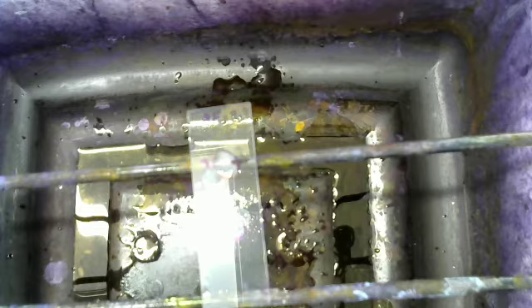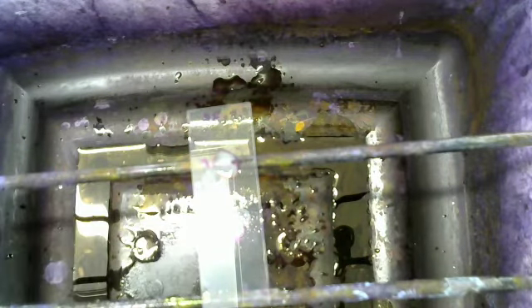Now we are going to do one last time. This time we're going to do it on the same slide. Here's our acid-fast positive and our acid-fast negative. Same as before, start with some carbolfuchsin.